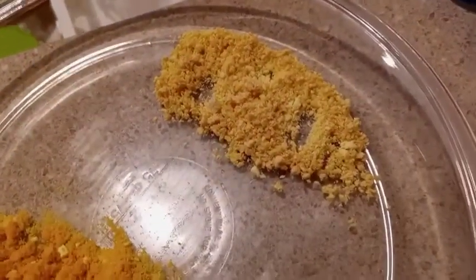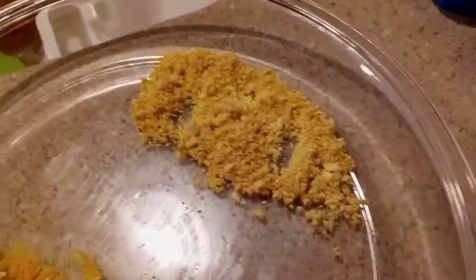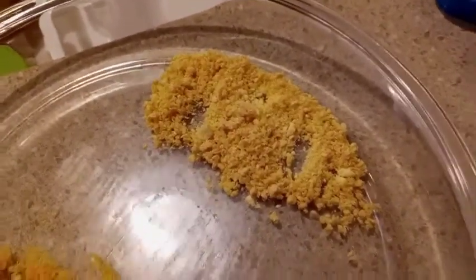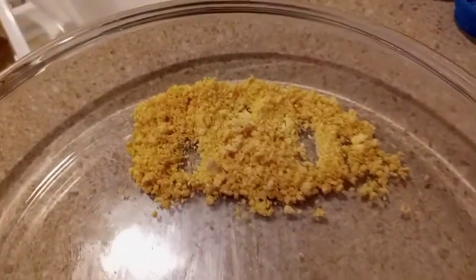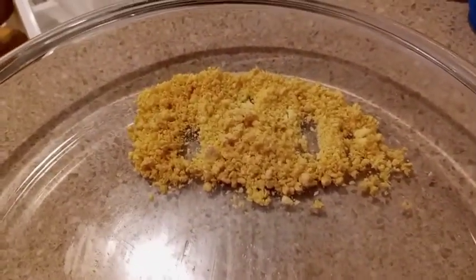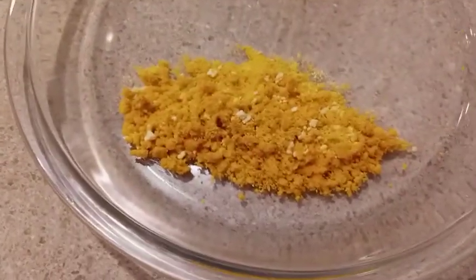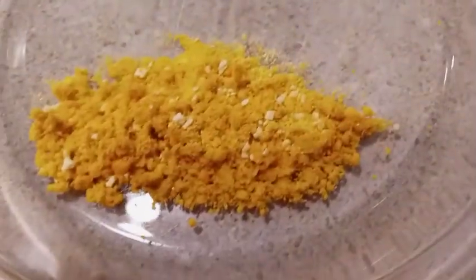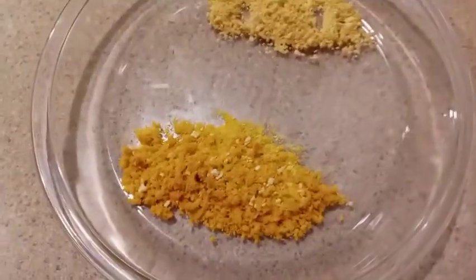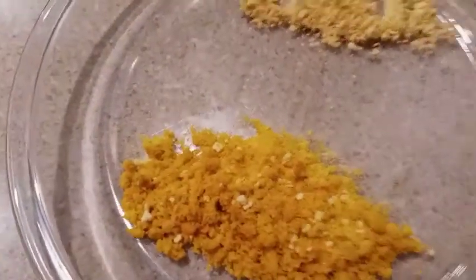This one, just like the other, after the potassium hydroxide was added, was crashed out and collected but not recrystallized. It looks much more pure. During crystallization I threw it in the fridge and let it sit overnight after crashing it out — it actually formed bigger crystals. Whereas this one formed more of just a fine precipitate. So white pepper is going to be the way to go. This took me about 15 minutes to filter after crashing out; this one took two hours — big difference. I believe a lot of oils were clogging the filter.